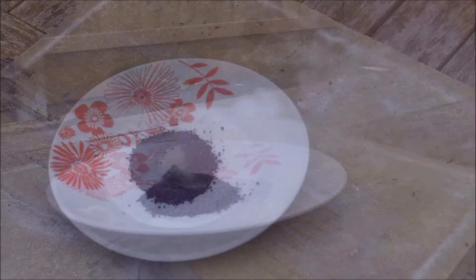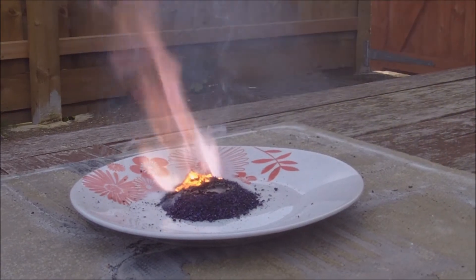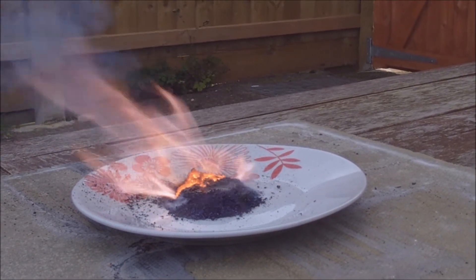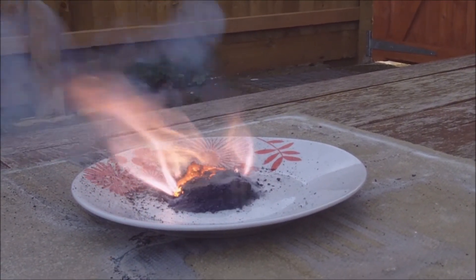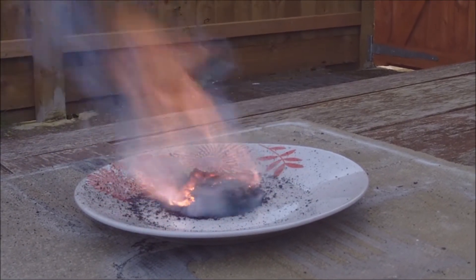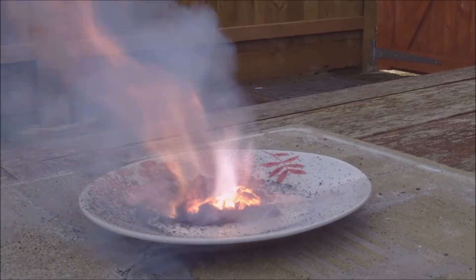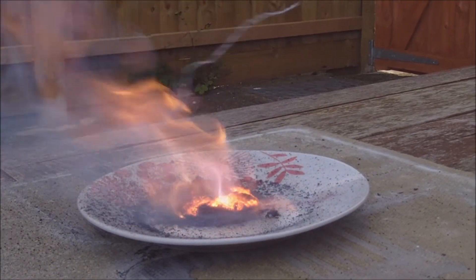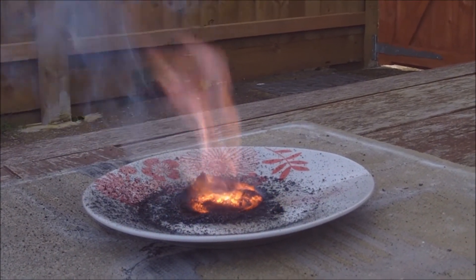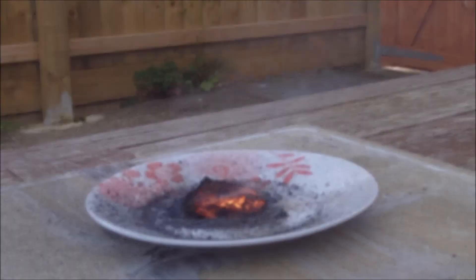And so as more of the glycerol is oxidized, the reaction will speed up.